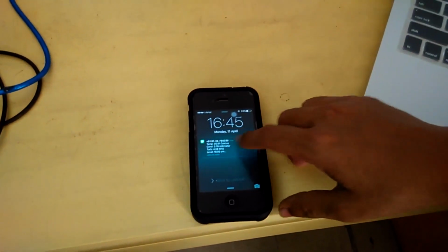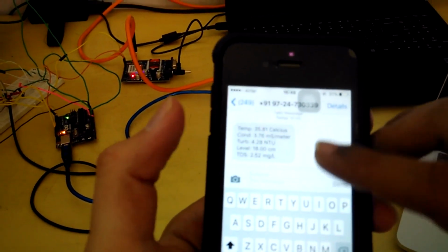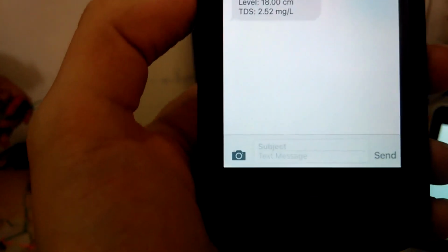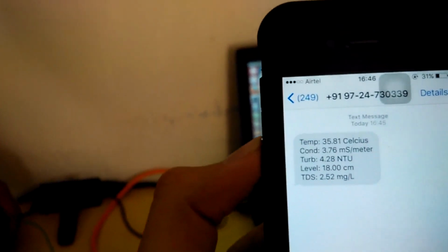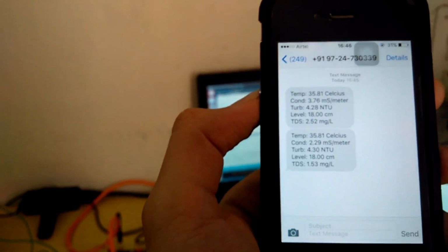There we are. So we have prepared a string, and we can read temperature 35.81 Celsius. Clearly summer has arrived. Conductivity, turbidity 4.28. So I suppose we are using dirty water. The level is 18 centimeters, which is a bit wrong, and the total dissolved salts is 2.52, which clearly means that the water which we have here is a bit difficult for the stomach. And so thank you guys for watching, and hopefully you liked our ramble. Thank you.